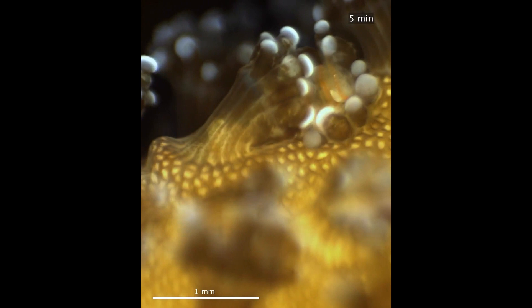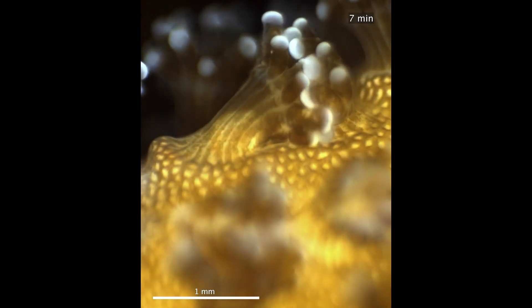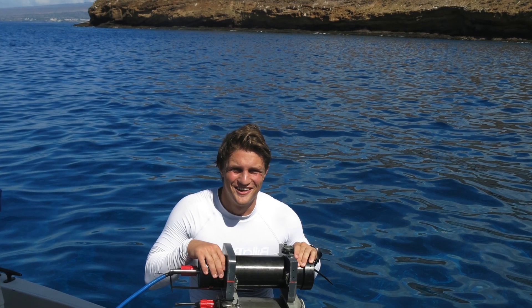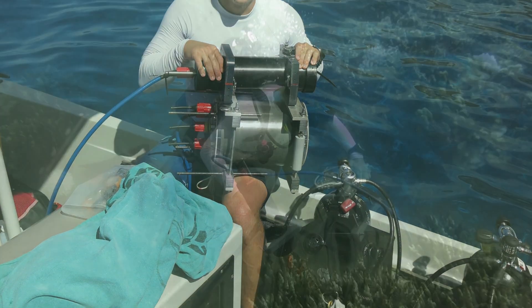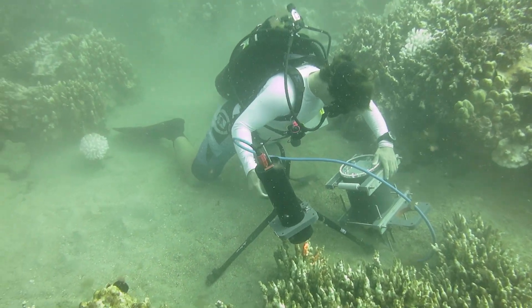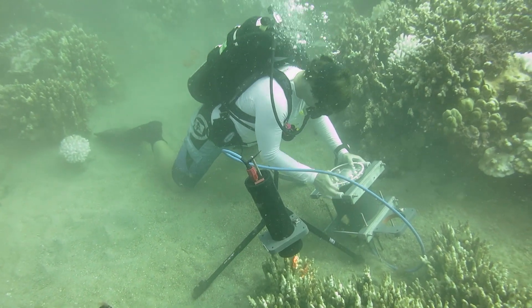With the instrument we were able to look at individual coral polyps and see their behavior and competition with other types of corals. I dive with the system to the subject I want to image and then I set the imaging unit up on a tripod and control it with the underwater computer.